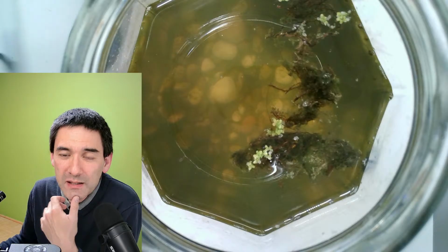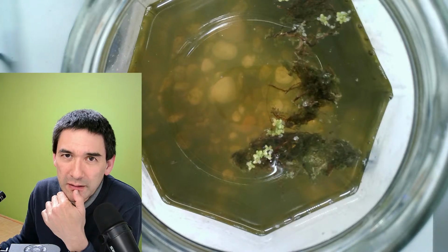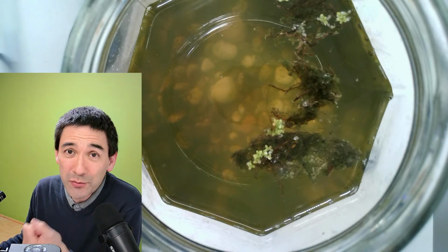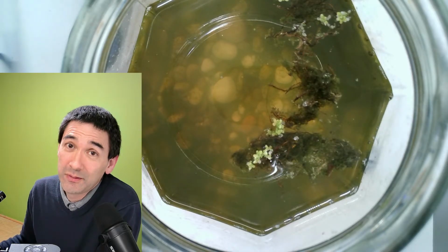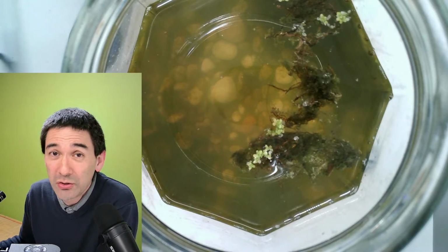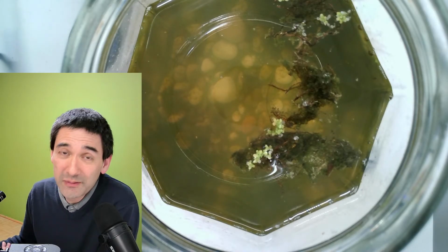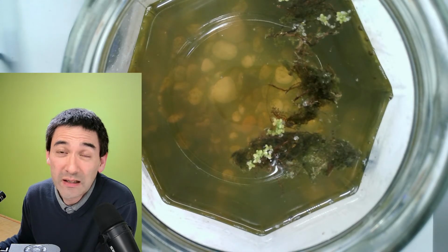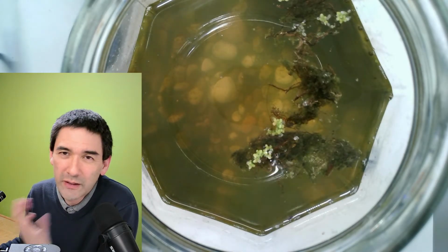Another thing that annoys me a little bit about software is the fact that those USB microscope cameras, I've not managed yet to connect them to a mobile phone. Basically they require their own drivers, and then you can connect them over USB to a computer. But I would like to connect them directly to a mobile phone. So that's actually a driver issue. There are some cameras around that allow you to go over Wi-Fi, but I would like to connect a USB camera directly to a mobile phone as well.